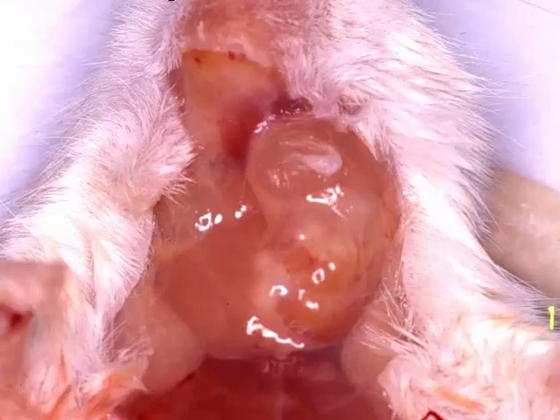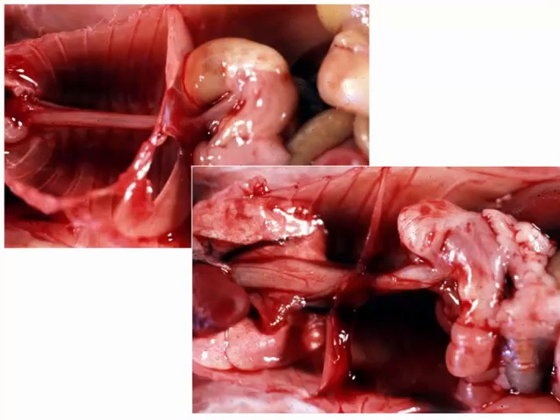And here's one more. Normal on the left, abnormal on the bottom right, and this is megaesophagus. Megaesophagus is usually seen in Swiss ICR mice. Affected animals have a longer segment of the esophagus with smooth muscle, as well as aplasia of the myenteric plexus, resulting in a diffuse dilation on both sides of the diaphragm.